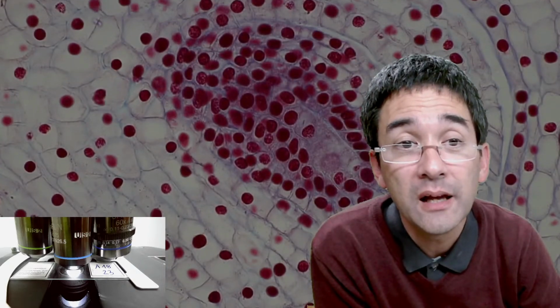Again, so I have to turn up the light again here. One of the nice things about those, by the way, I can recommend this if you don't know what to observe under the microscope, and if you need some quick specimens to look at, or if you want to make some nice pictures of something, then I do recommend permanent slides as well, because they can be easily shown to other people. And they kind of look nice, especially plant cross sections, because of this irregular pattern. It's nice for photography.